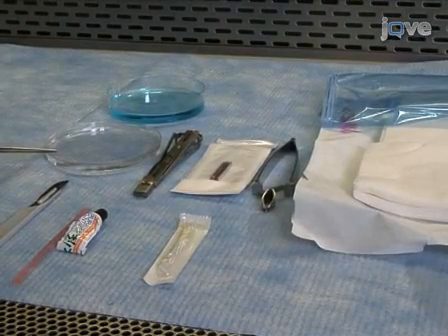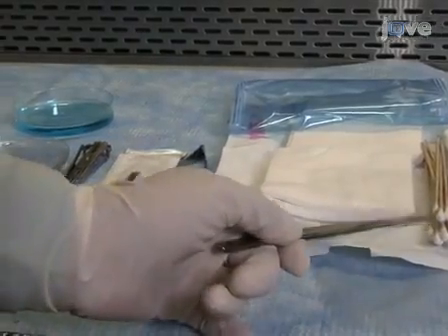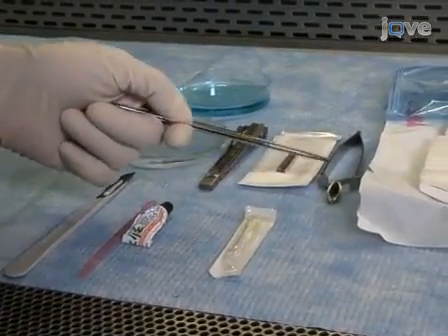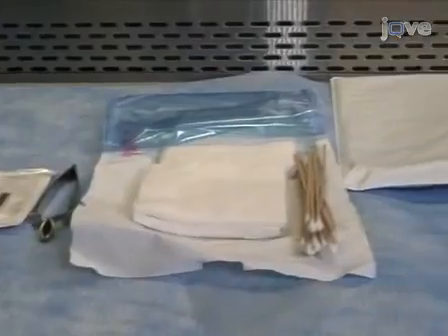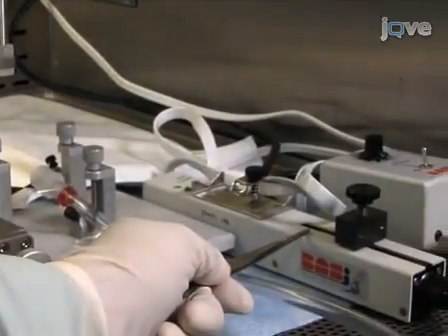2 small petri dishes, 1 containing 3% hydrogen peroxide and 1 containing 2% chlorhexidine, sterile gauze and cotton swabs, sterile disposable number 21 scalpels, autoclaved mouse skin stapler, staples and staple remover, sterile 20 gauge needles, heating pad to maintain mouse body temperature, a mouse stereotaxic frame, and a controlled rate syringe pump.